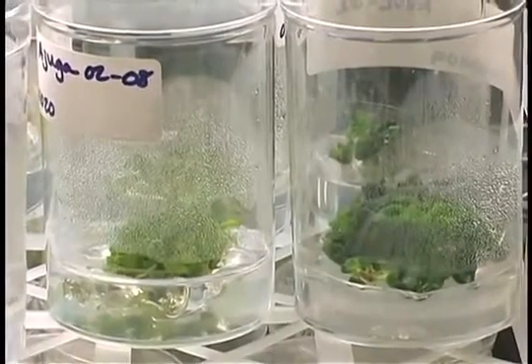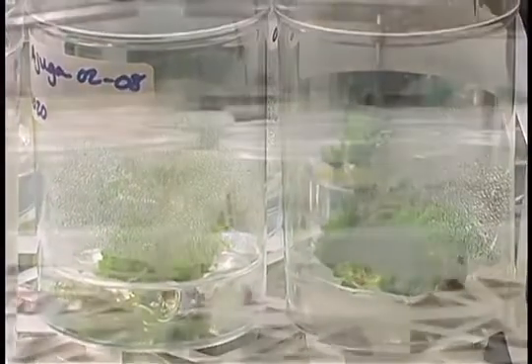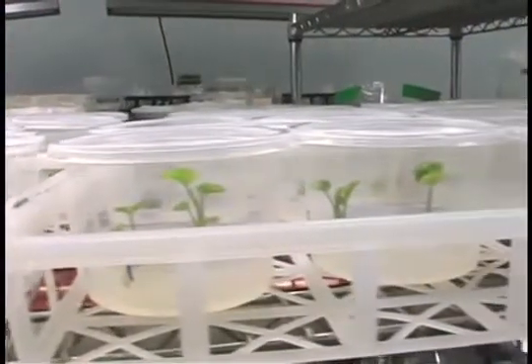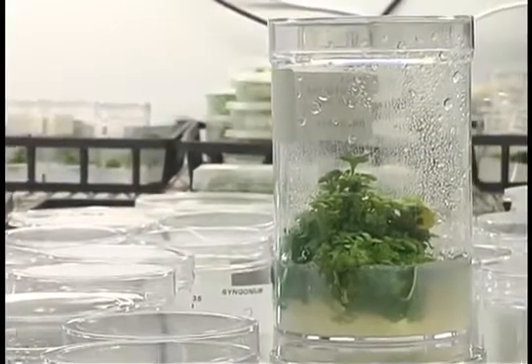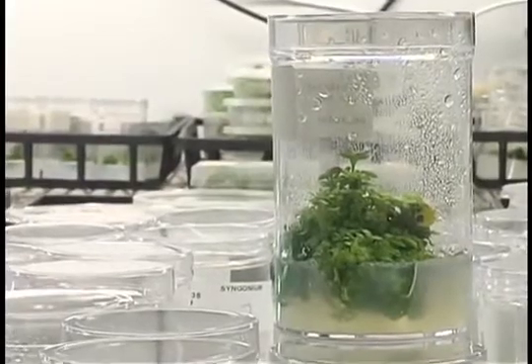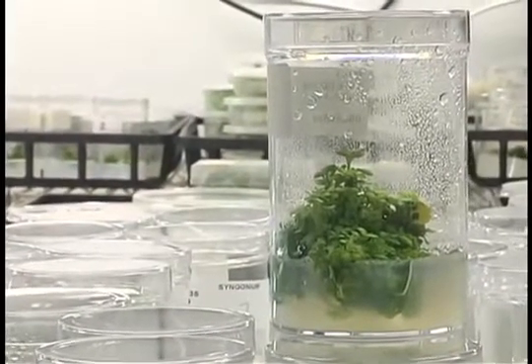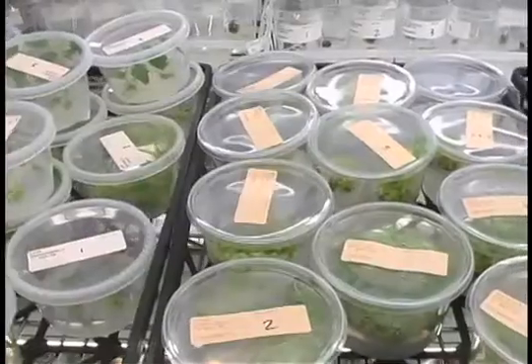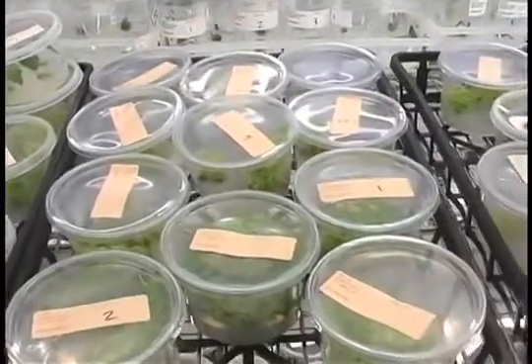This is not easy because bacteria and fungal spores are in the air, on us, in us, and under us. When you see sunlight shining in a window, you can from certain angles see dust particles in the air. There are hundreds of bacteria attached to each dust particle.